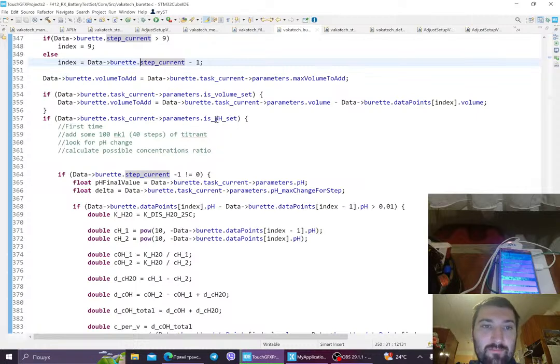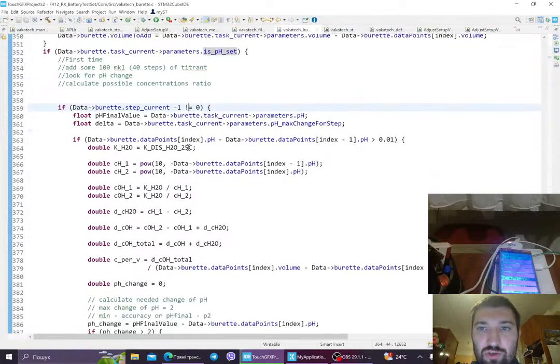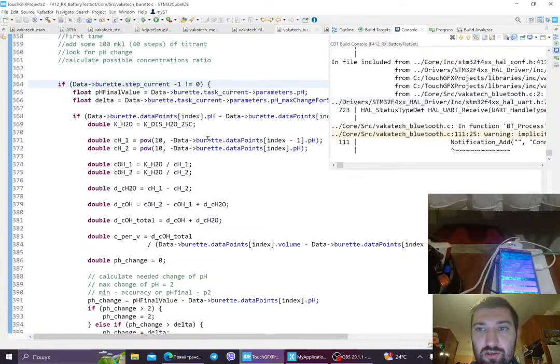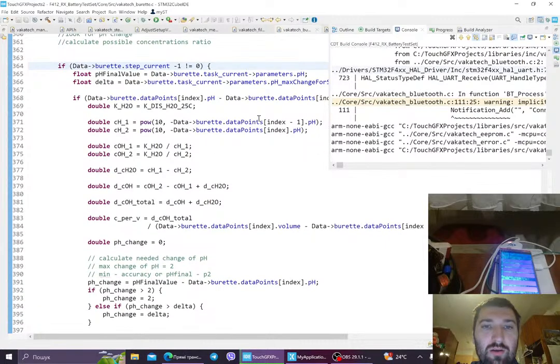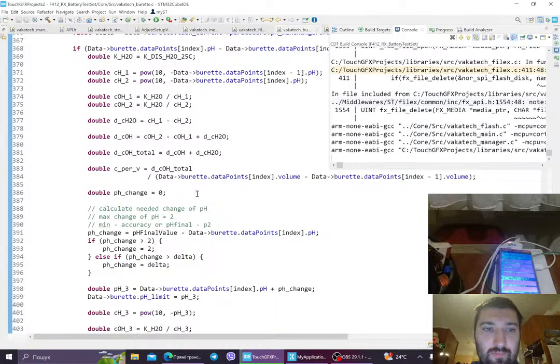Once we have the parameter pH that we want to change to some pH, we will see with each tick, with each addition, if we moved anywhere. Yeah, like, did we move?